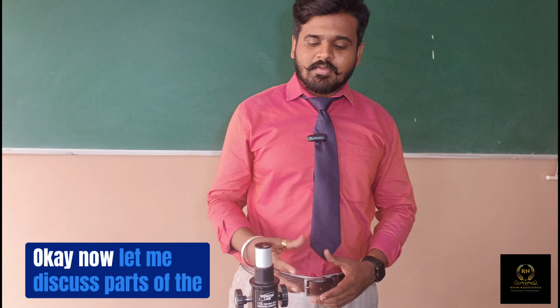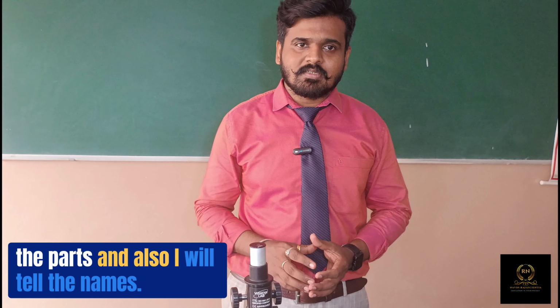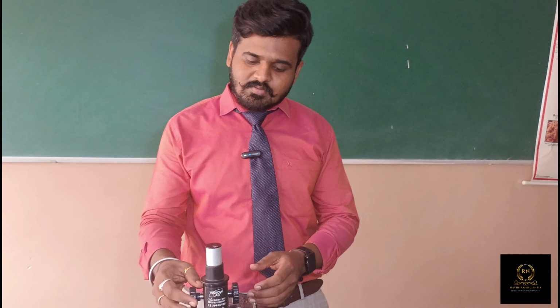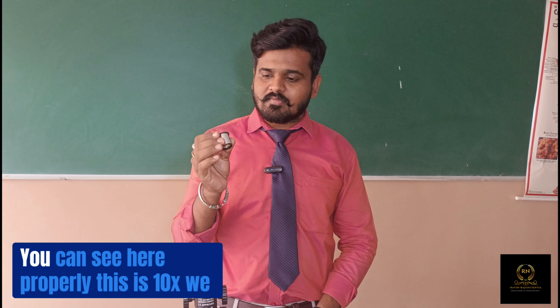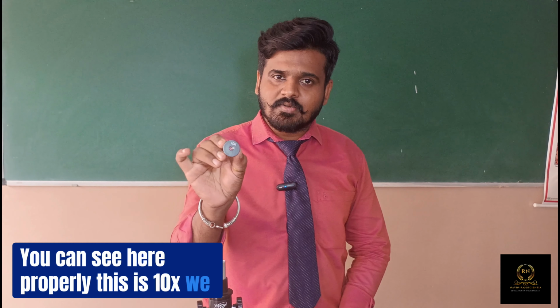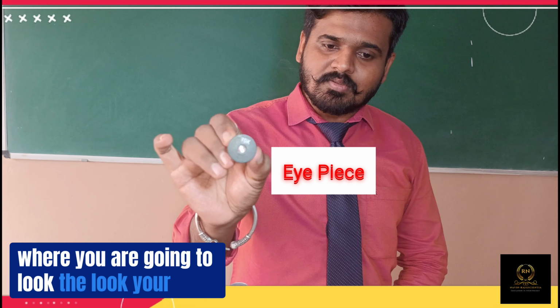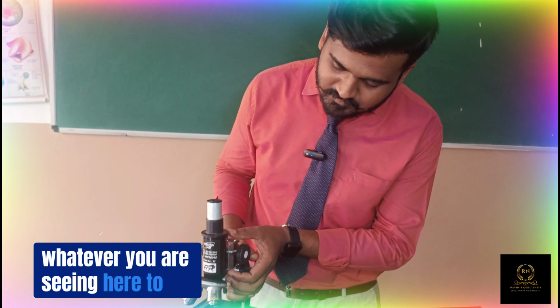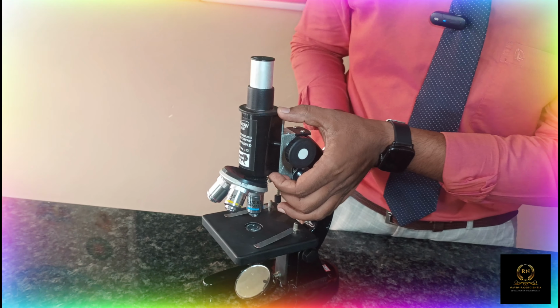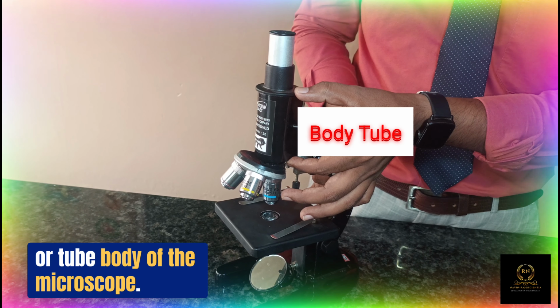Okay, now let me discuss the parts of the microscope. One by one I'll show the parts and also tell the names. So first we'll go with the eye lens. This is the eyepiece. You can see here properly, this is 10x. We call it an eyepiece, where you look at your specimens. Remember this 10x. And next, this part, from here to here, this is the tube or body tube of the microscope.